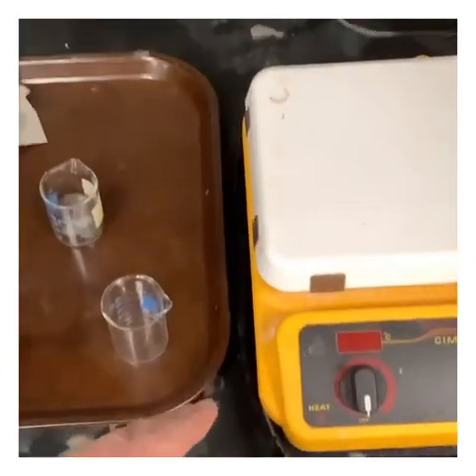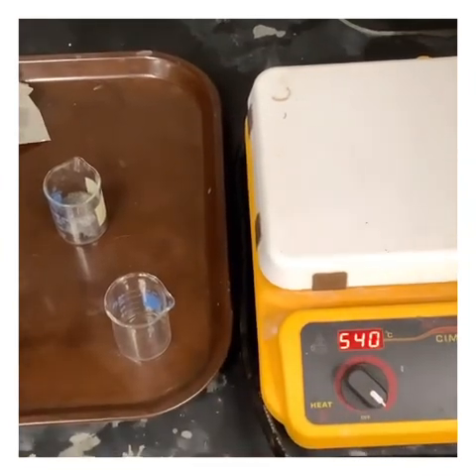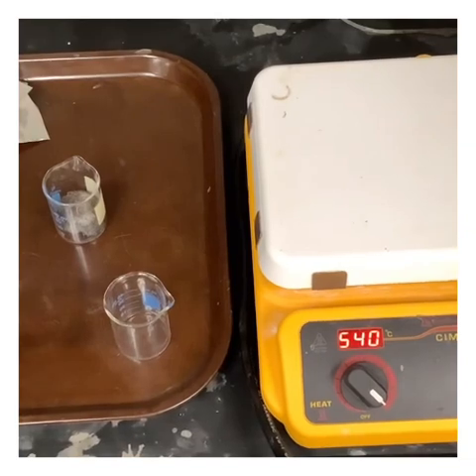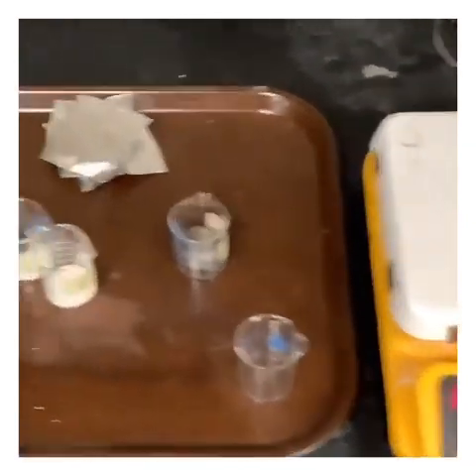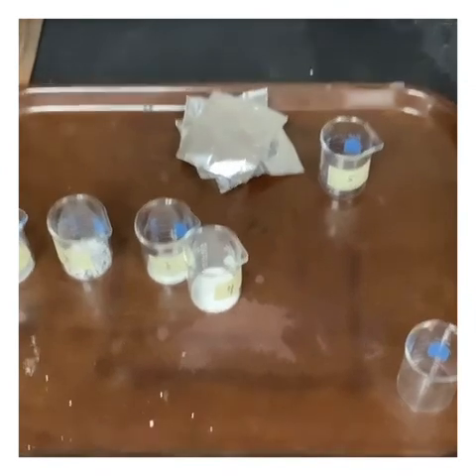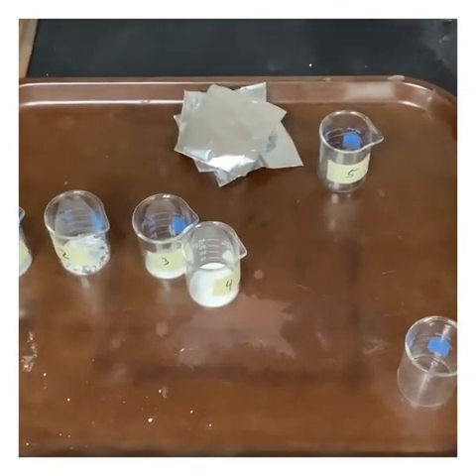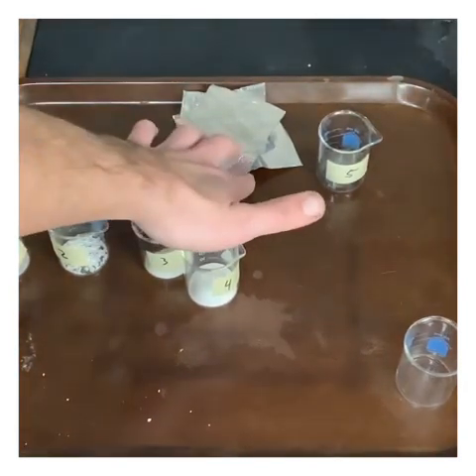So when we turn our hot plate on, the maximum temperature that the hot plate can reach is 540 degrees Celsius, not 1,000. So what we're going to do is take each one of these samples, with the exception of number 5. Number 5's box should be crossed out. We are going to place them on the hot plate, which means we're going to bring them up to about 540 degrees.